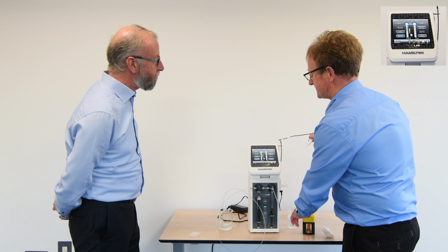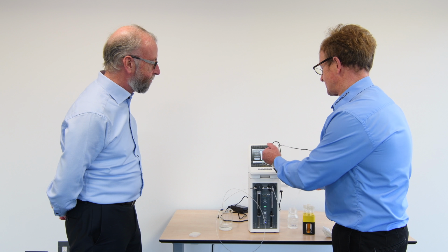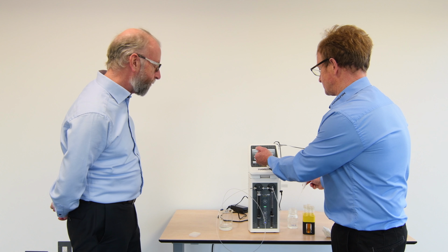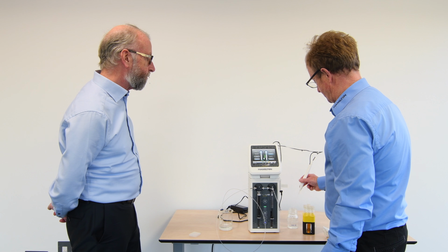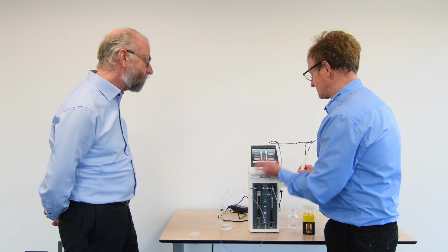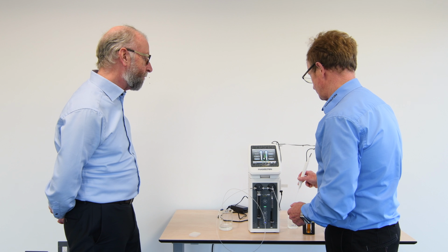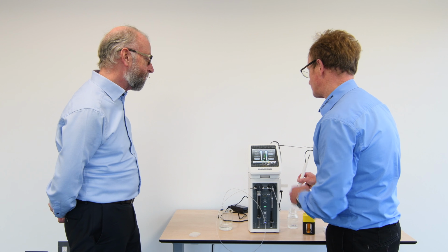At the moment this is a manual trigger function, so I can dispense that into waste. And you'll notice the syringe has gone in, but it's going to fill again with the additional volume here, giving us our full volume of operation there. So we've completed that wash cycle. Good. To show that whole cycle there, ready for the next program step.